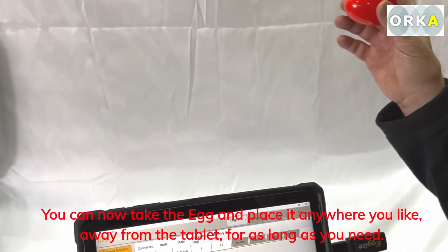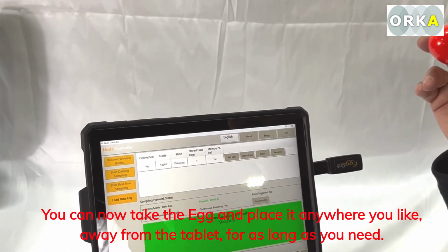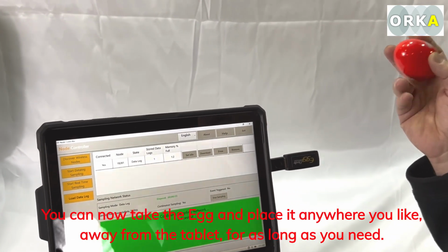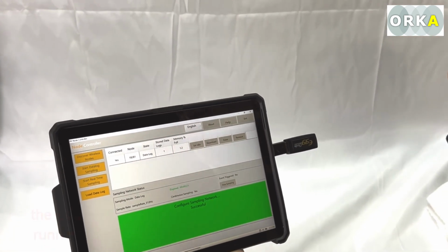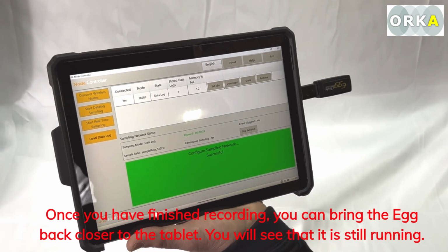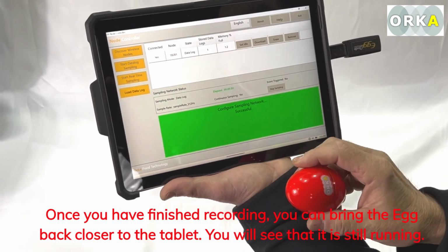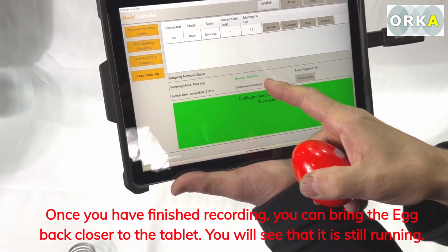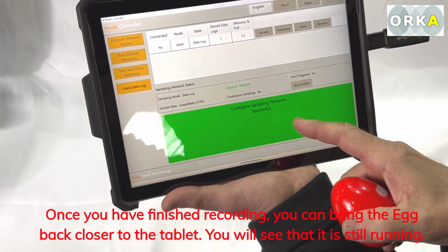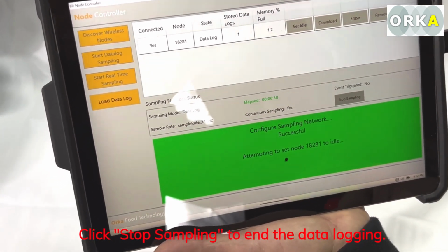You can now take the egg and place it anywhere you like, away from the tablet, for as long as you need. Once you have finished recording, you can bring the egg back closer to the tablet. You will see that it is still running. Click Stop Sampling to end the data logging.